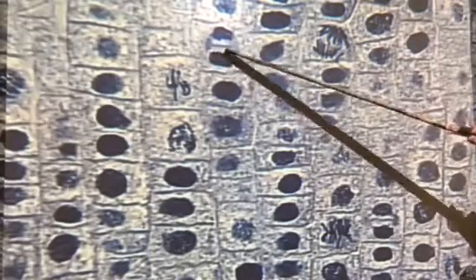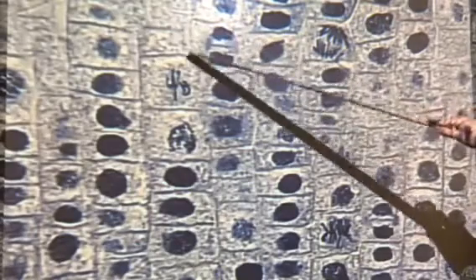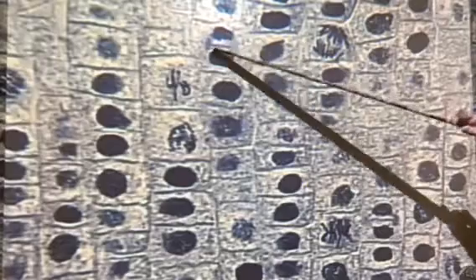And I like it because this looks like a new cell wall to me. So this looks like the old big cell here. They just split, and this is a new cell wall. I also like this one right here too, where this is the new cell wall, and they just split and went this way and that way. That one's a little tougher to see, but I've shown you all four examples.